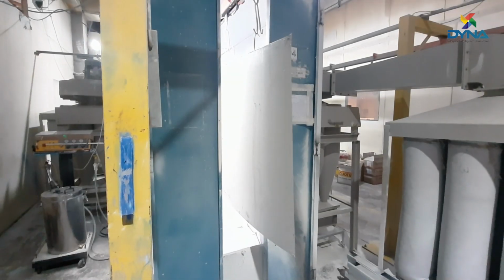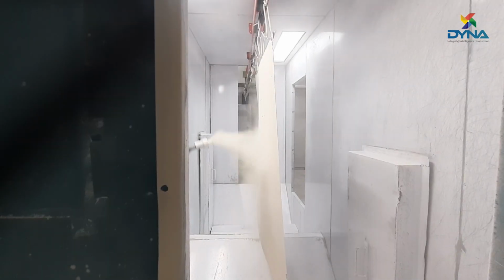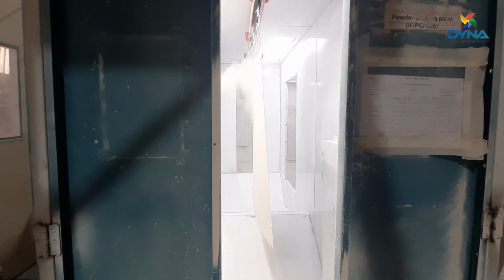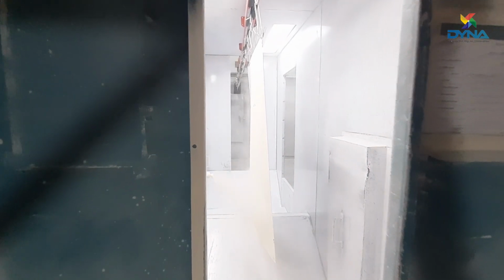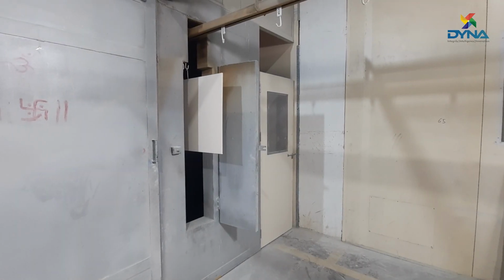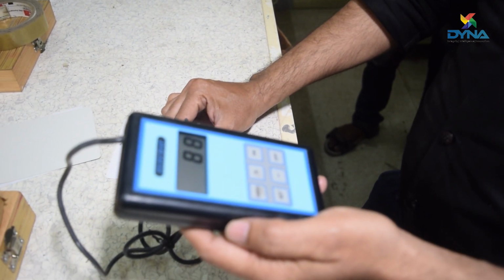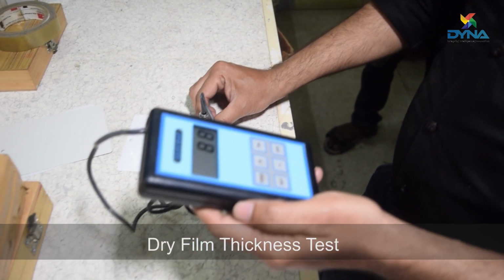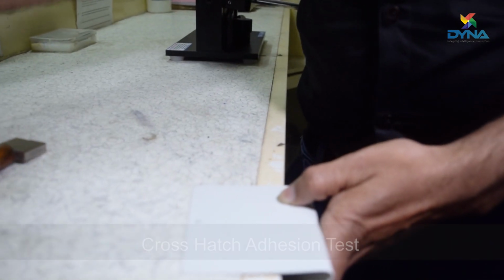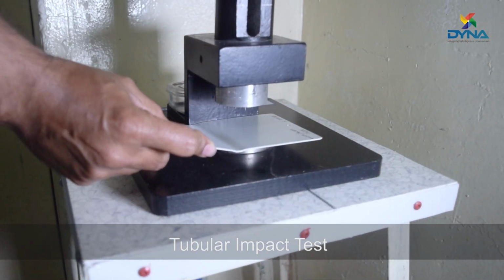With a high-capacity conveyorized automatic powder coating line that churns out 1500 square meters of panels per day, Dyna's cleanroom panels are waterproof, fire-safe, corrosion-proof, and chemical proof. Our panels are tested at our in-house test setup that includes sophisticated test equipments to facilitate dry film thickness test, cross-hatch adhesion test, conical mandrel bending test, and tubular impact test.